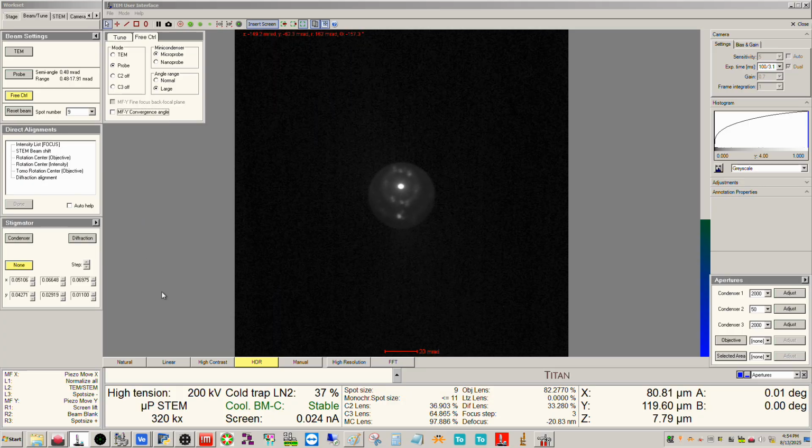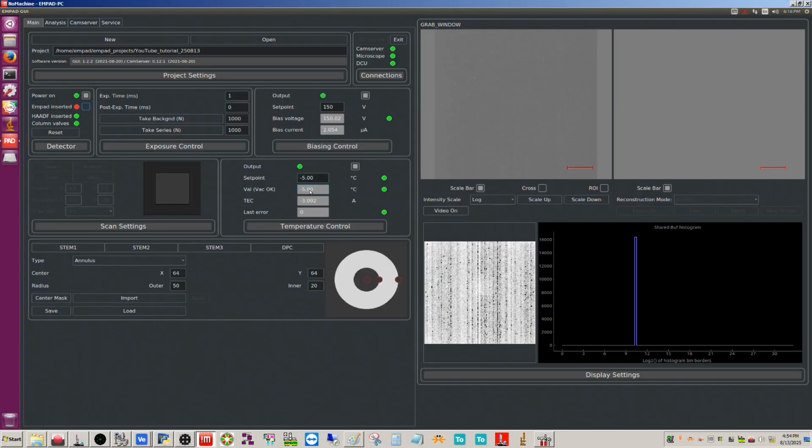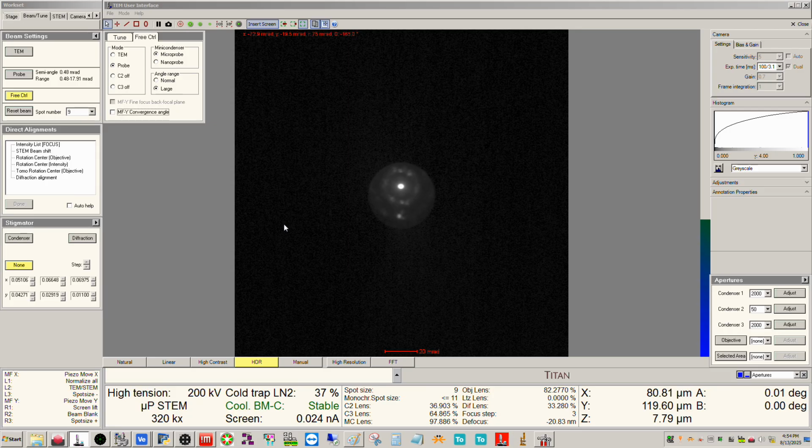Again, you want to use a high enough camera length for that. And how are we doing here? We're almost at the set point. I think I've covered doing that in previous videos, so I'm not going to go through that again. But my experience is that this is actually closer to about 1 millirad than half a millirad.